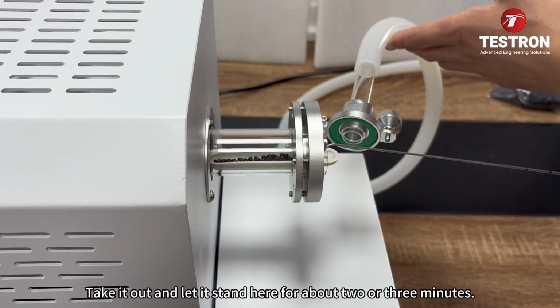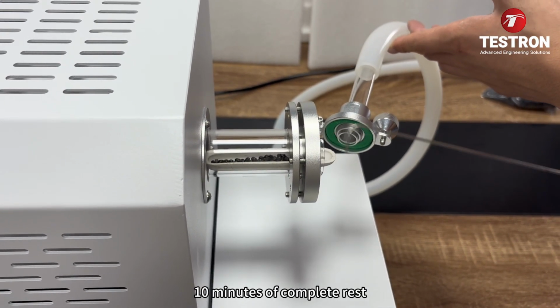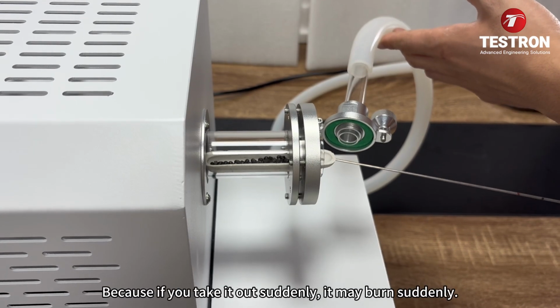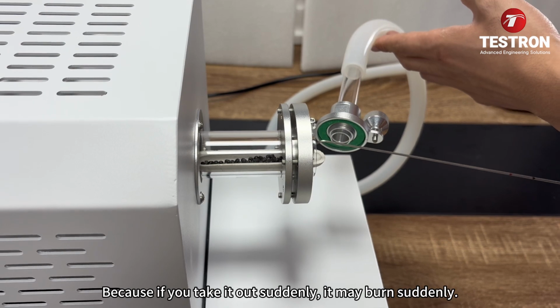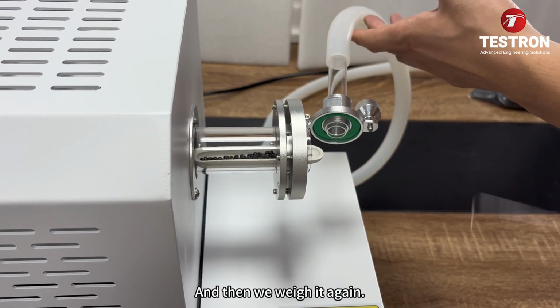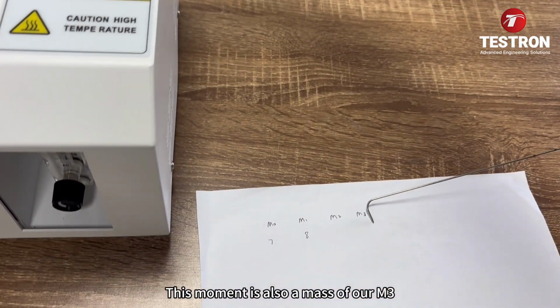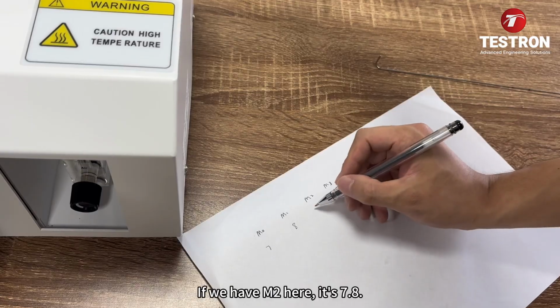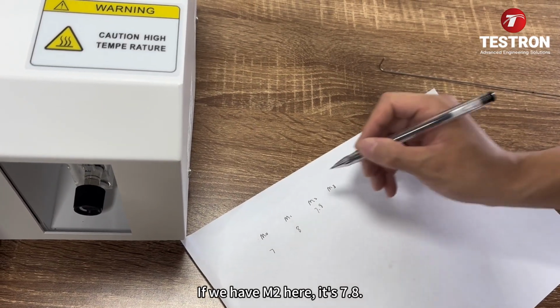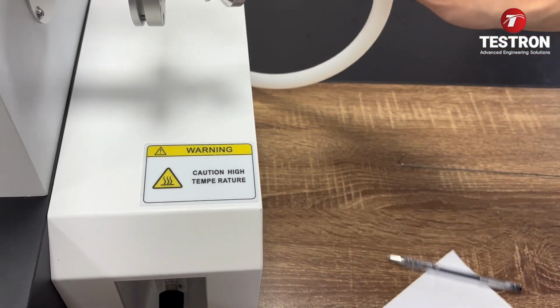Take it out and let it stand here for about 2 or 3 minutes. 10 minutes of complete rest, because if you take it out suddenly, it may burn suddenly. And then we weigh it again. This moment is also the mass of our M3. If we have M2 here, it is 7.8. M3 is 7.5, and then we go in turn.